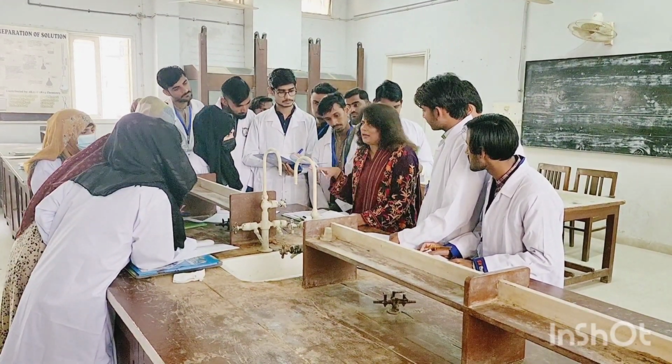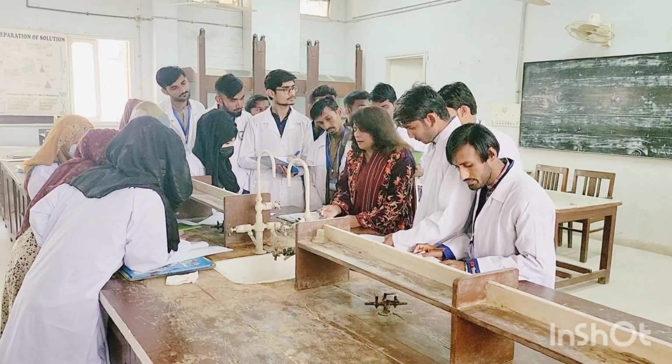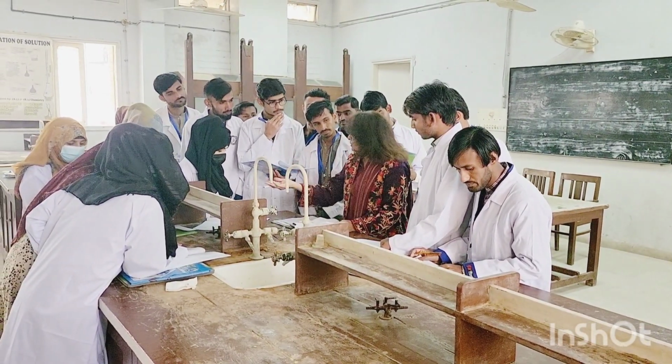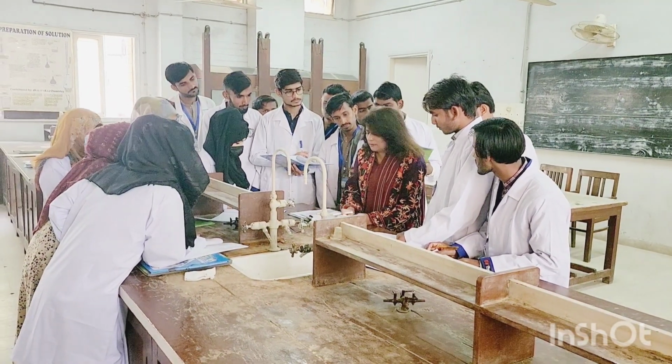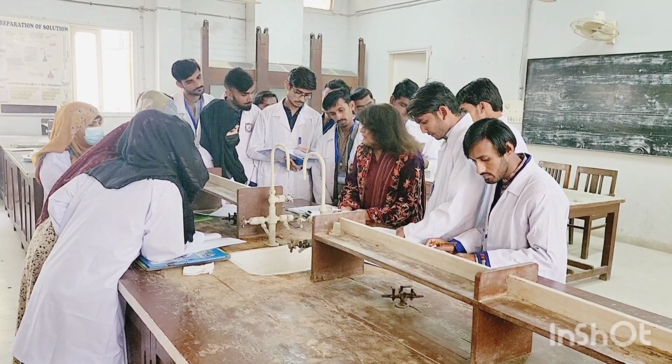Methyl alcohol, ethyl alcohol. You will take the 2 ml and then you are going to add a few granules of your organic compound that is being given to you. You will pour that and then you will stir a little bit, shake. They have written us shake well. Then test with a litmus paper.